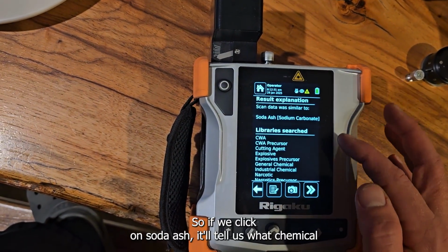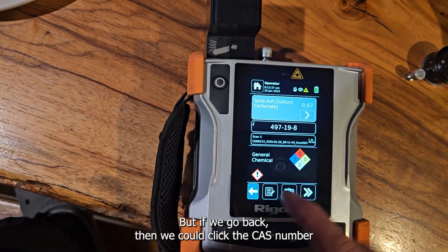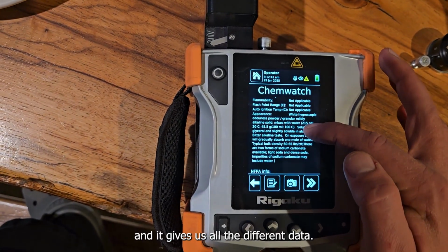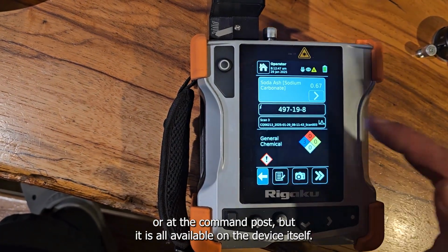So if we click on soda ash, it'll tell us what chemical or what it scanned it through and where it was at. But if we go back, then we could click the CAS number, and it gives us all the different data. It's probably easier to look this up on your phone or at the command post, but it is all available on the device itself.